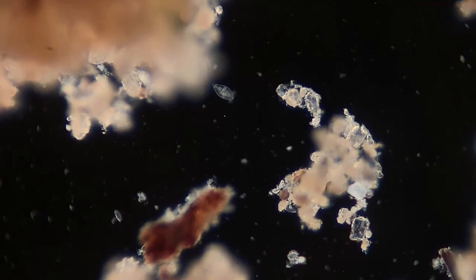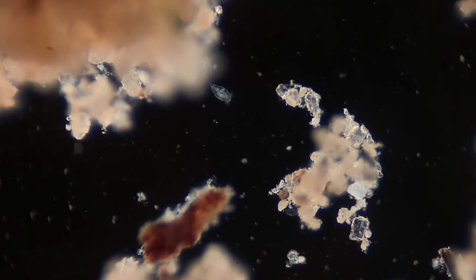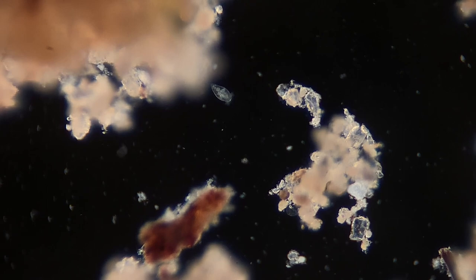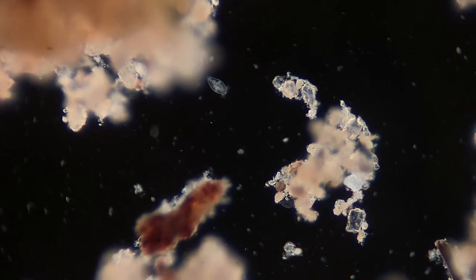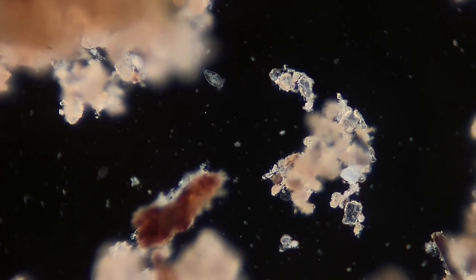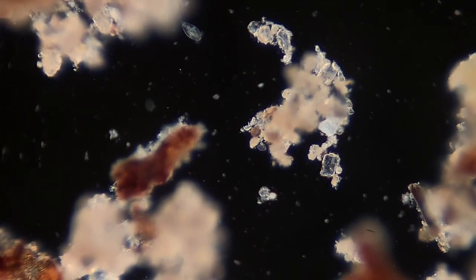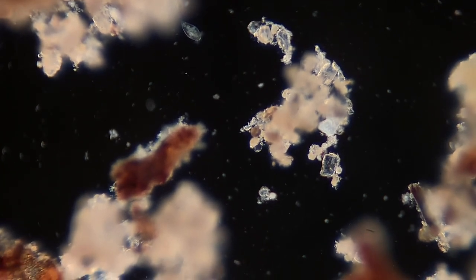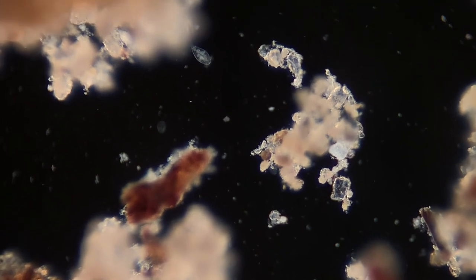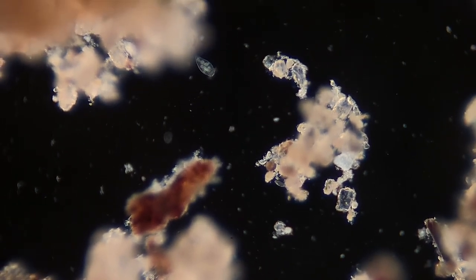I'm going to go one by one and explain the common microbes that I found in this sample. In this video, you're seeing about five or six milliliters of rainwater, and I saw about four, maybe five types of microorganisms. So let's start off with this one here.